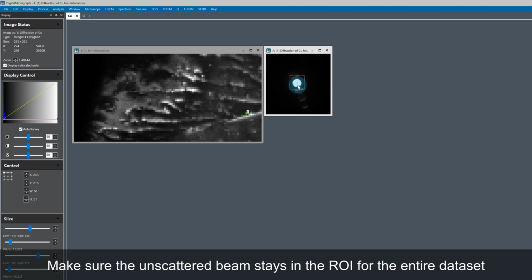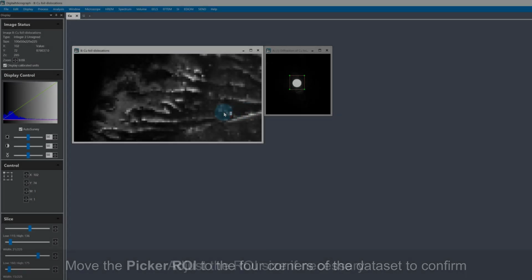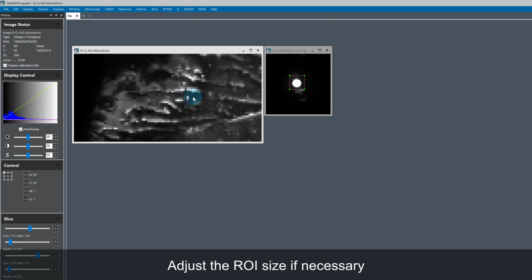Make sure the unscattered beam stays in the ROI over the whole dataset by moving the picker ROI around to the four corners of the 4D dataset. Adjust the ROI size if necessary.